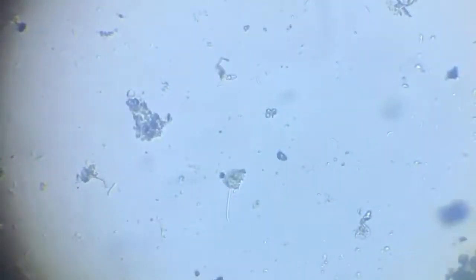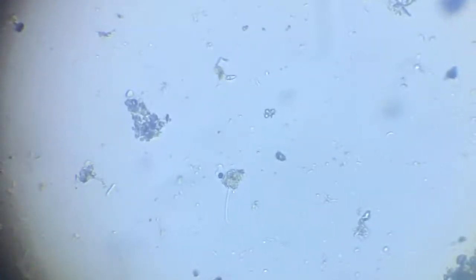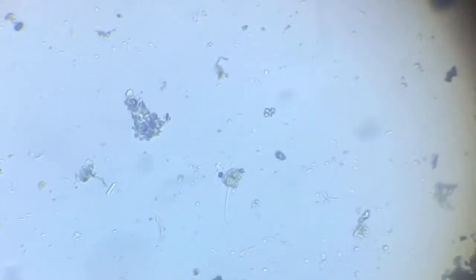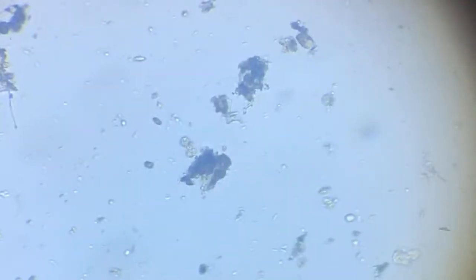That is what I was saying. That's a worm kind of a thing, which we shall work again more with. Here it comes again. I believe it's a larva of some flatworm or some other worm, simple, just a worm or something.